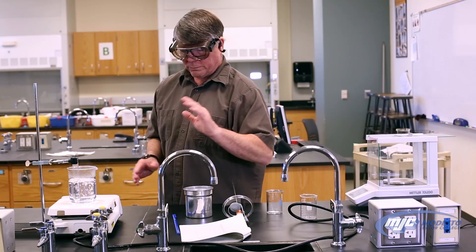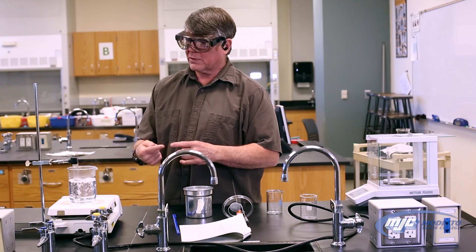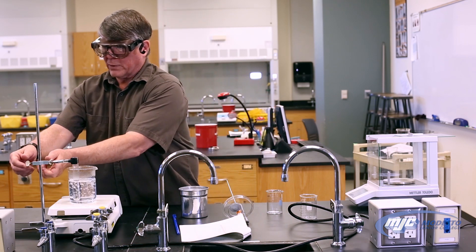Now I'm going to have my table to record the temperatures every 15 seconds. So at time equals zero, we don't measure because we're doing stuff, but at 15 seconds and every 15 seconds after we record the temperature. So looks like we're ready to go. Been 10 minutes. We've got all our numbers.